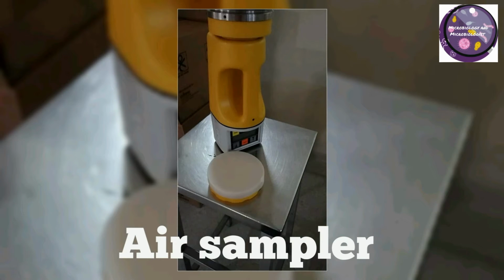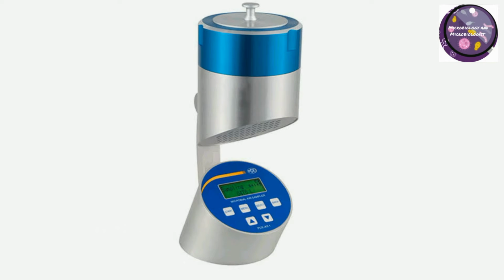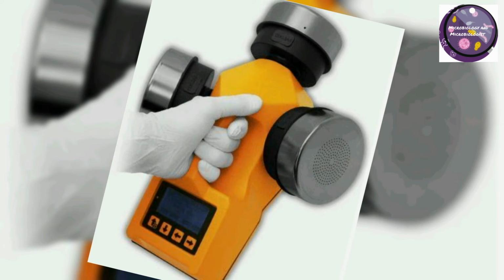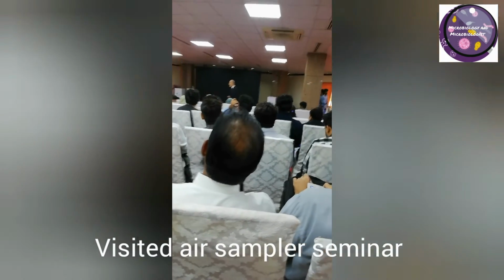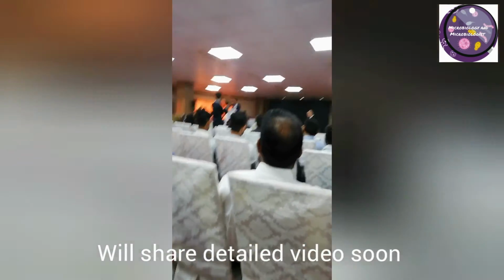Air sampler. In active monitoring, a microbial air sampler is used to force air into, or onto its collection medium, for example, petri dish with nutrient agar-based test media, over a specified period of time. A variety of different sampling devices are currently available to acquire air samples of microbial and viral particles. These technologies include filters, impingers, impactors, and wet or dry cyclones.